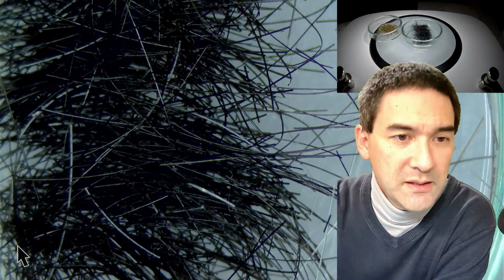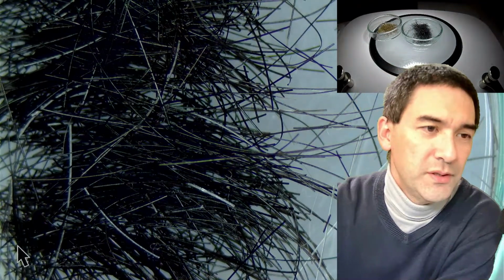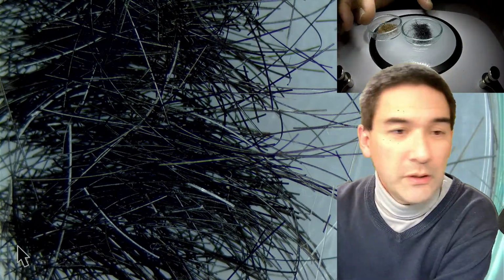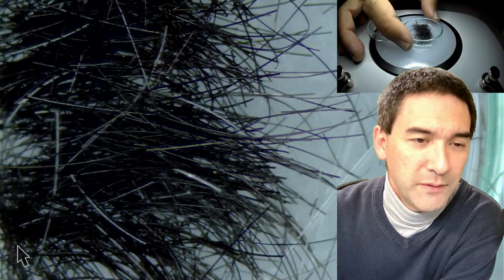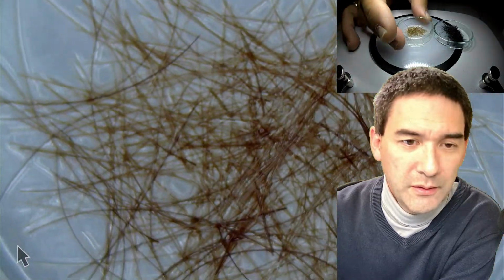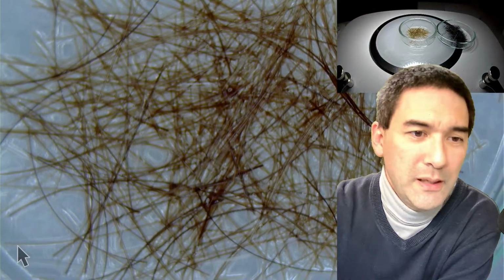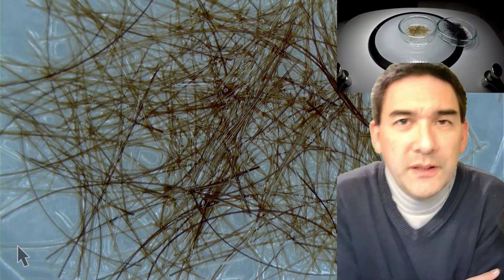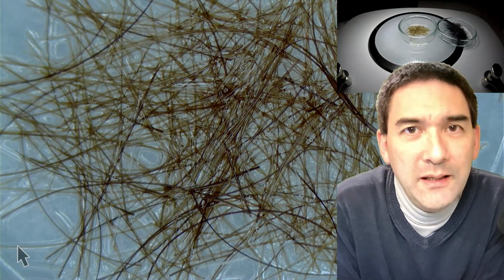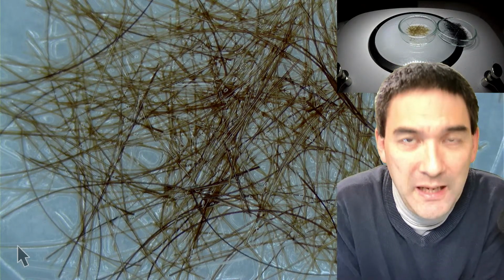So that's the original hair that I cut off. You see that there are some individual hairs that are still kind of white. And look at this guy over here. What in the world happened here? Why is it brown? It's my hair. However, what I've done today in the morning, I added hydrogen peroxide, H2O2.